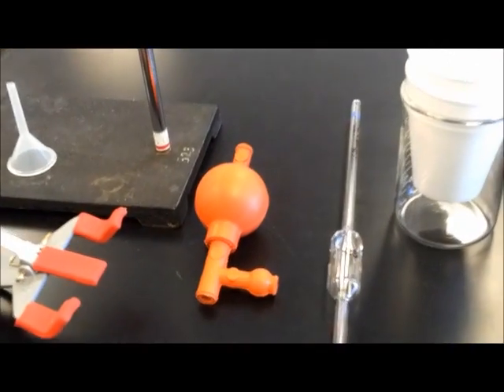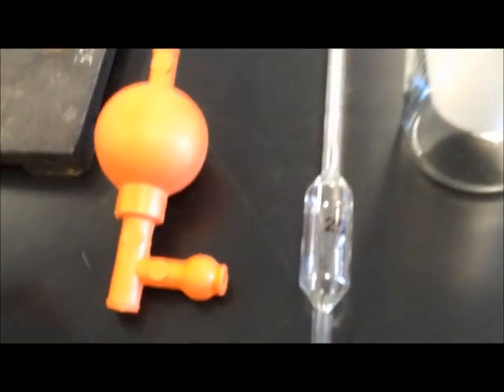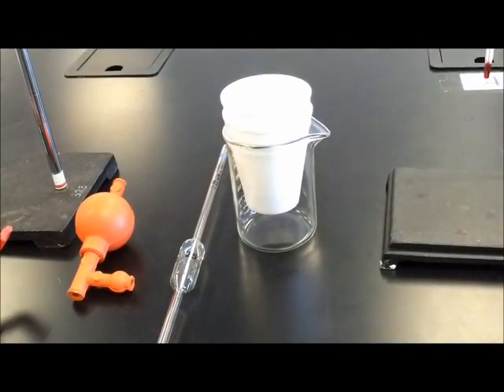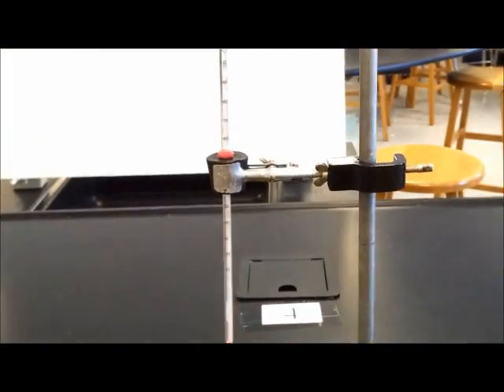We also need a pipette filler, a volumetric pipette, in this case 25 centimeters cubed, two styrofoam cups in a beaker, and a thermometer with another clamp.